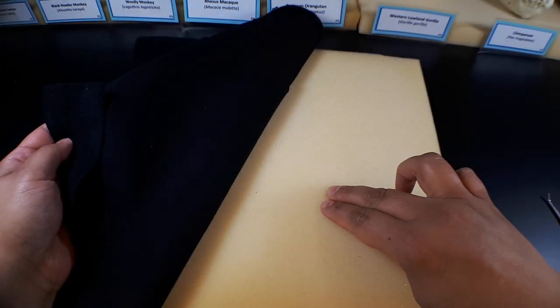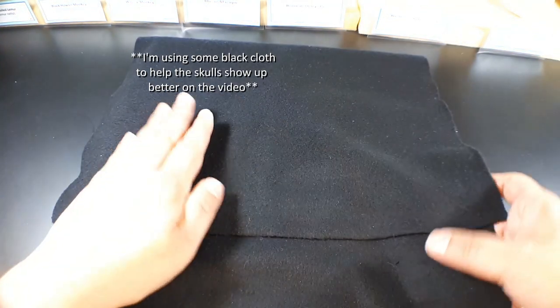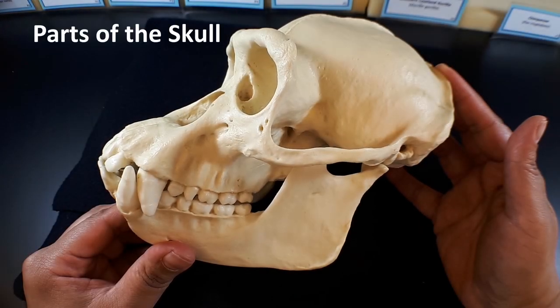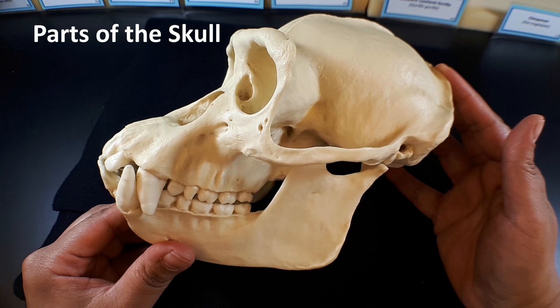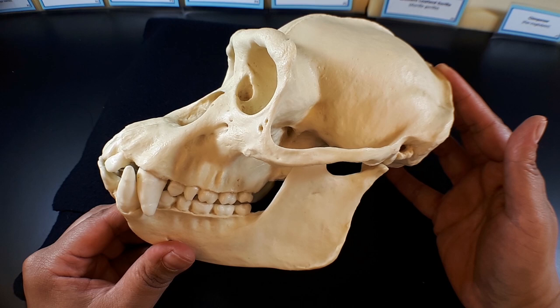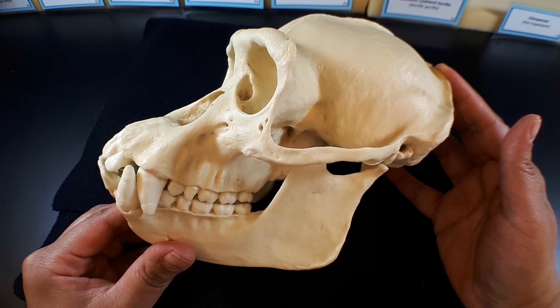The skulls are very delicate so make sure to use the foam square provided and be very careful when handling them. Once you have your foam pad in place you can familiarize yourself with the different parts of the skull. I'm using the chimpanzee skull for this part of the video but you can start with any of the available skulls.